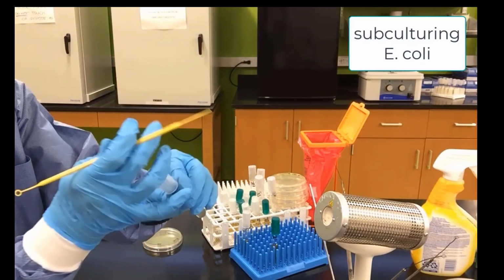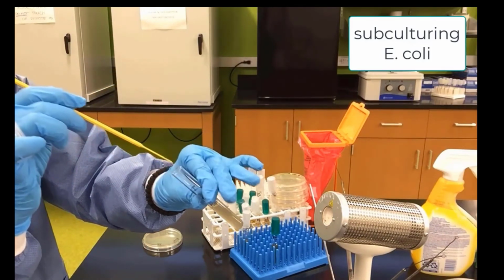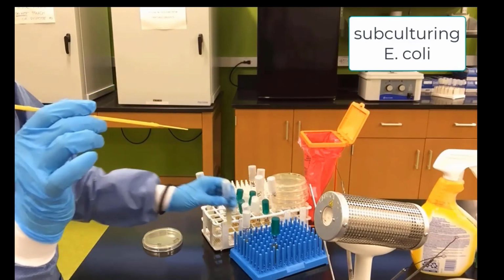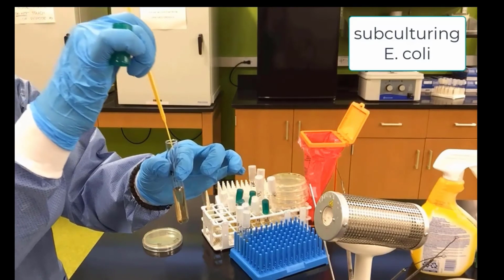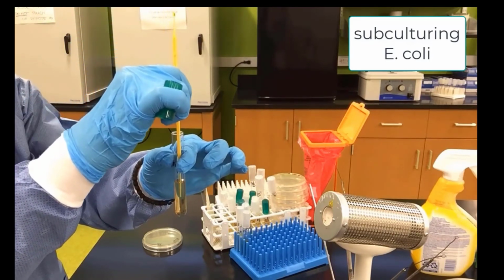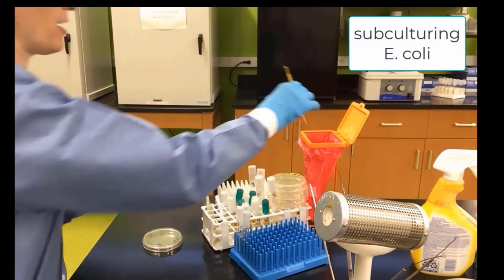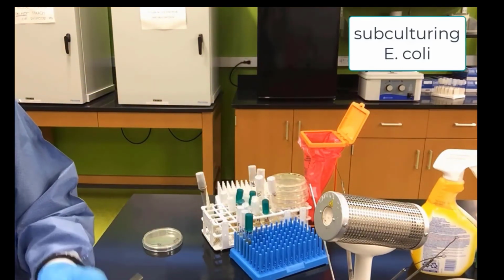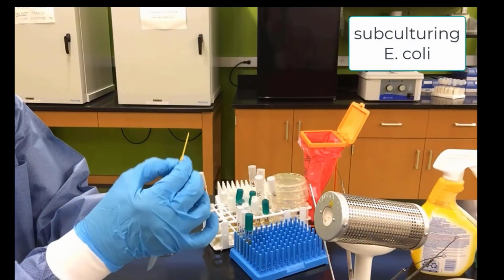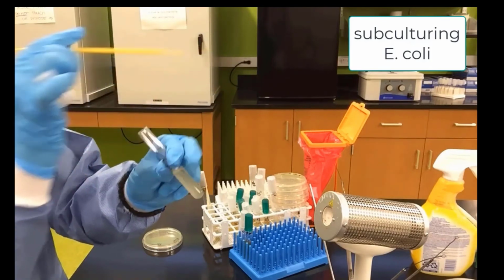We can use the needle end. Go in very carefully and stab our gelatin. This is a little straighter for the needle. Yeah, you can see it going straight in. That's perfect. And then we throw away our disposable loop. We are almost done with demonstrating the technique.